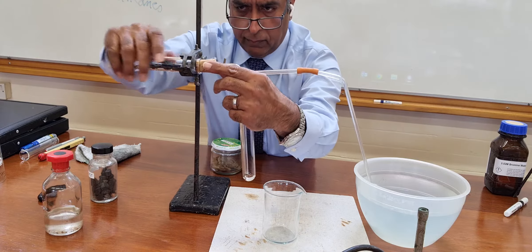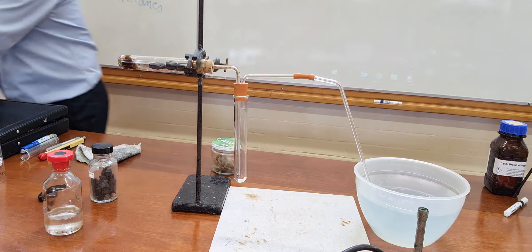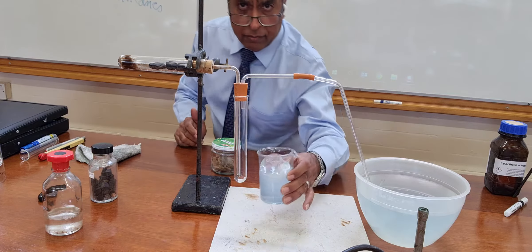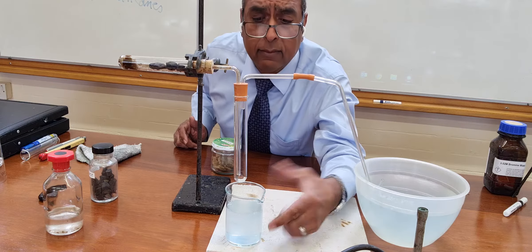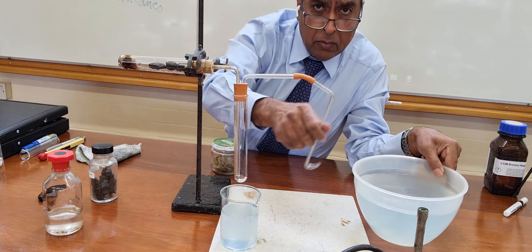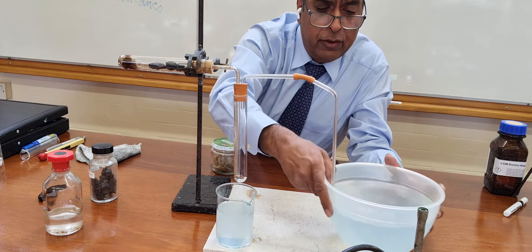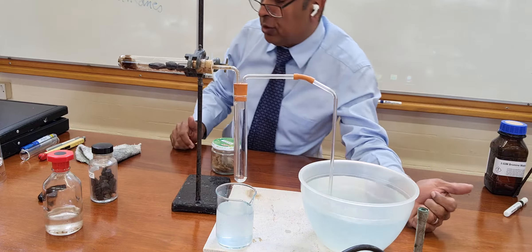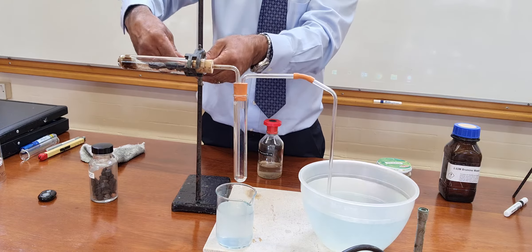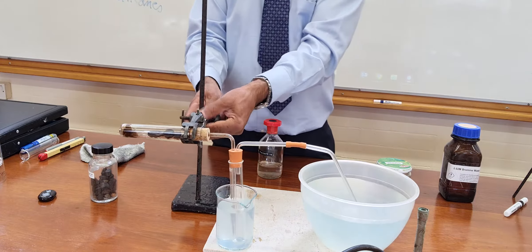I'm going to set the apparatus up like this. I put some water in here — water from the tap. This water is going to cool the middle test tube down. I'm going to lower it in, and I put the delivery tube in there so the bubbles of gas that come off I can try and collect and see what they are. I'm going to lower this down like that.